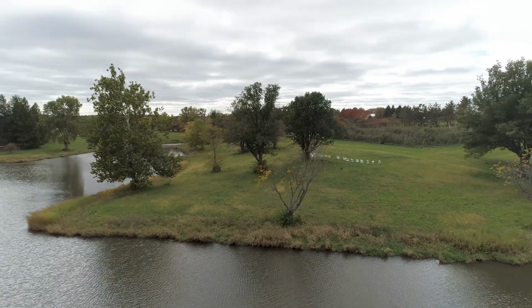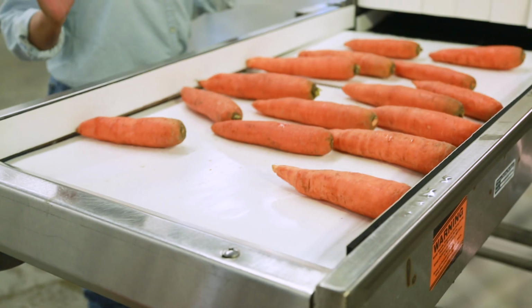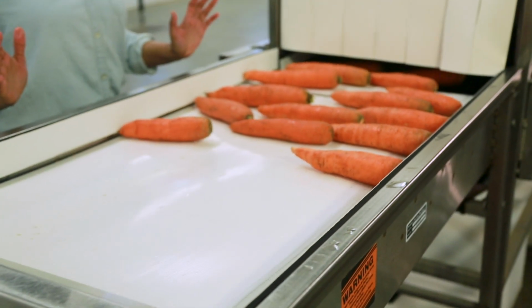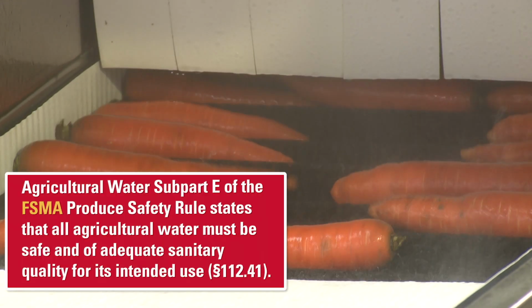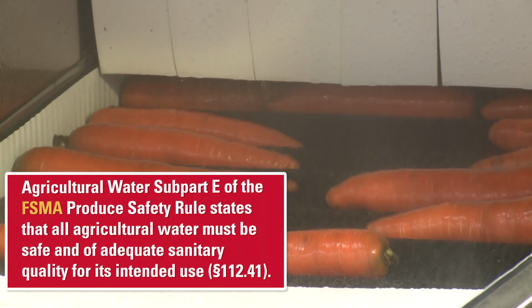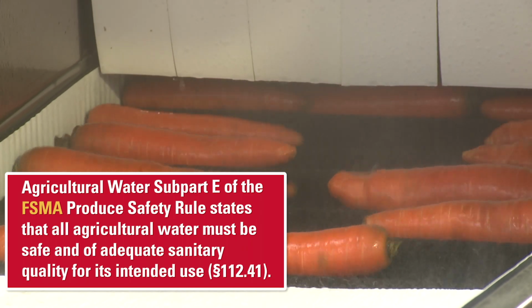Agriculture water quality is regulated under the Food Safety Modernization Act Produce Safety Rule. Protecting the safety and quality of your fresh produce is very important. Subpart E of the FSMA Produce Safety Rule states that all agricultural water must be safe and of adequate sanitary quality for its intended use.